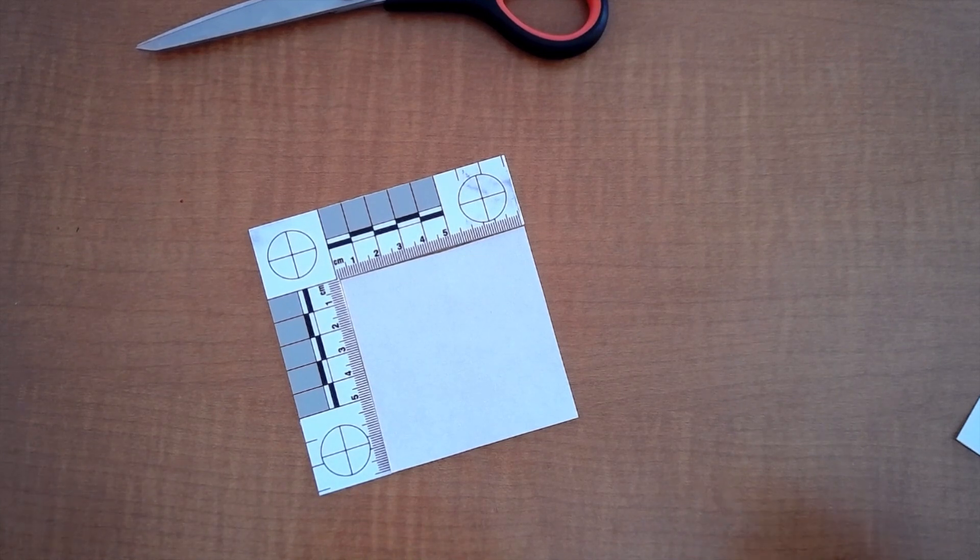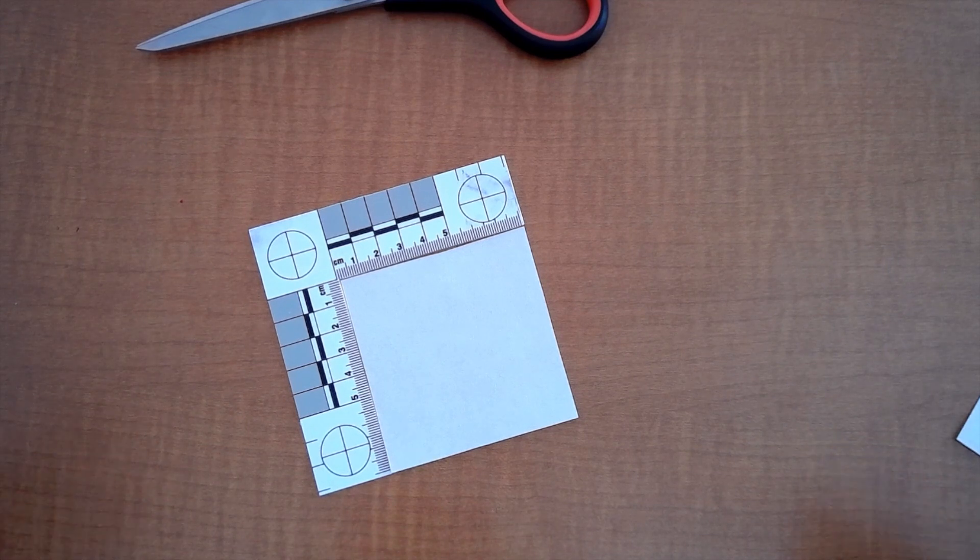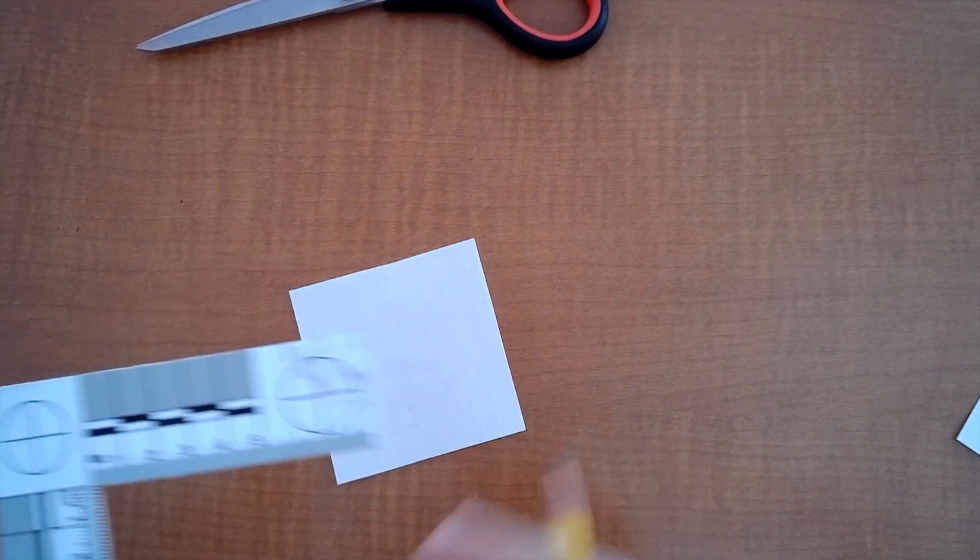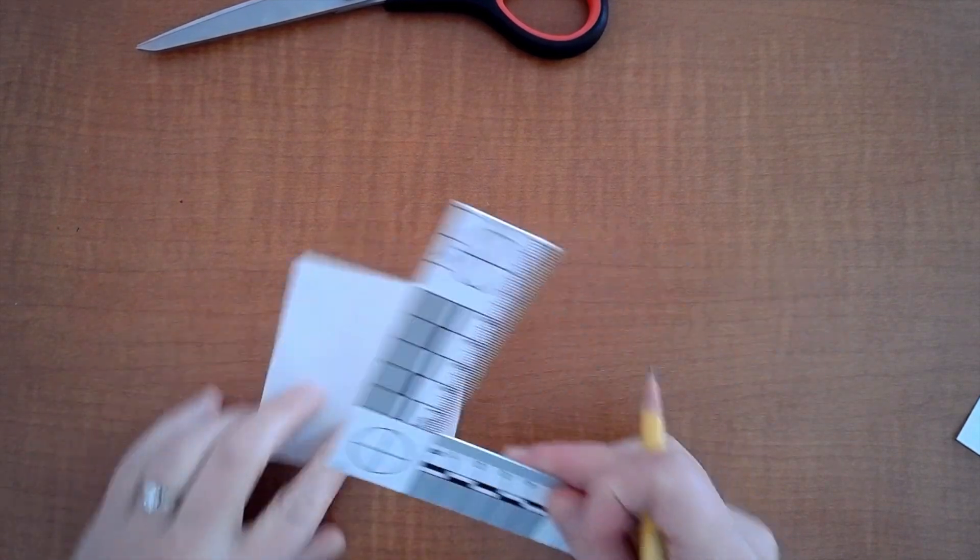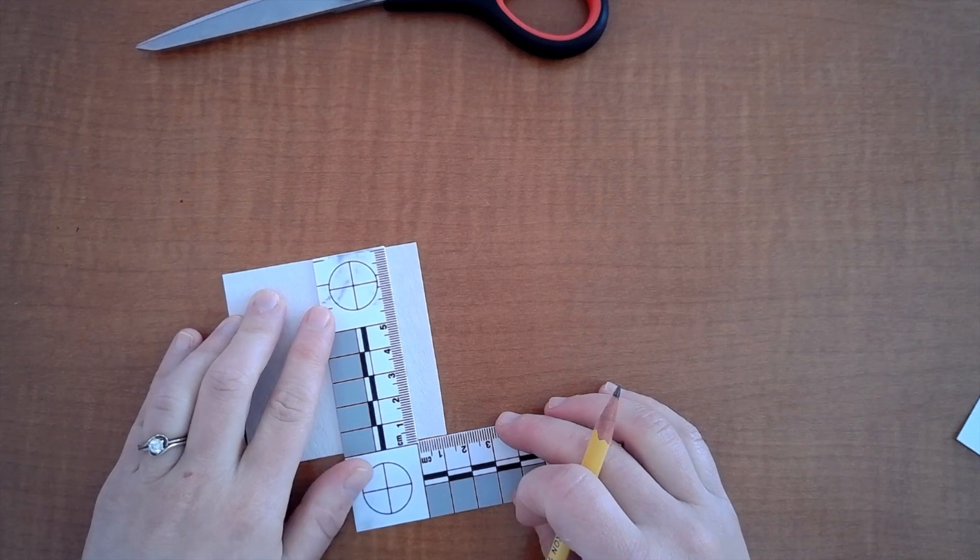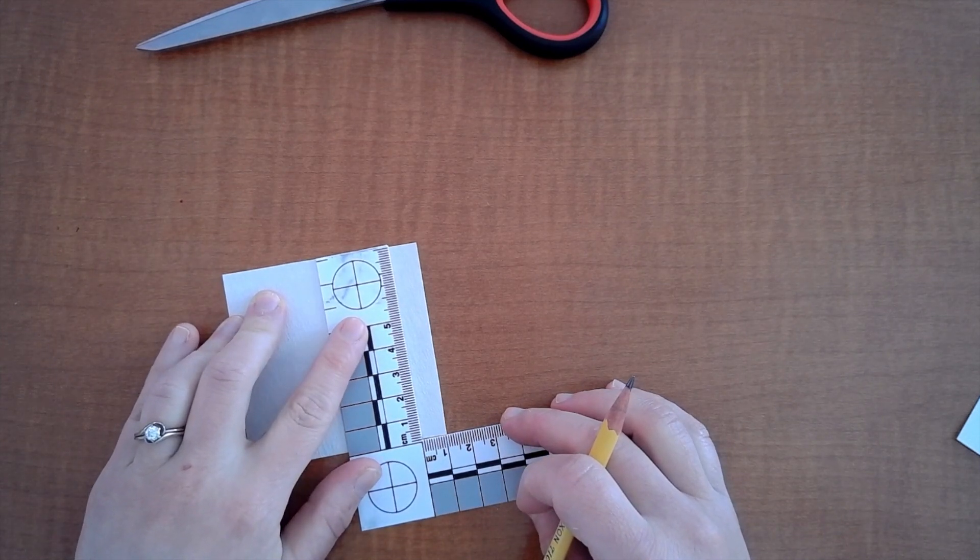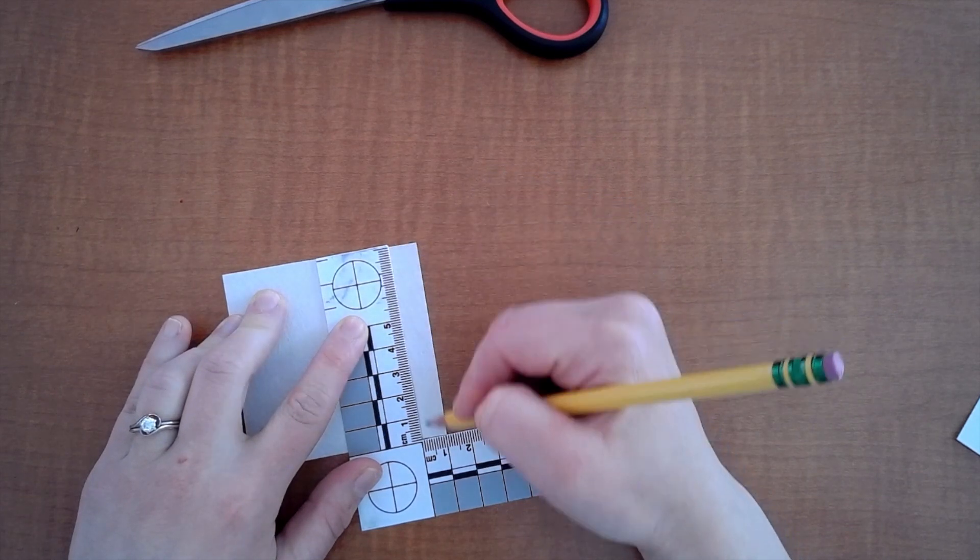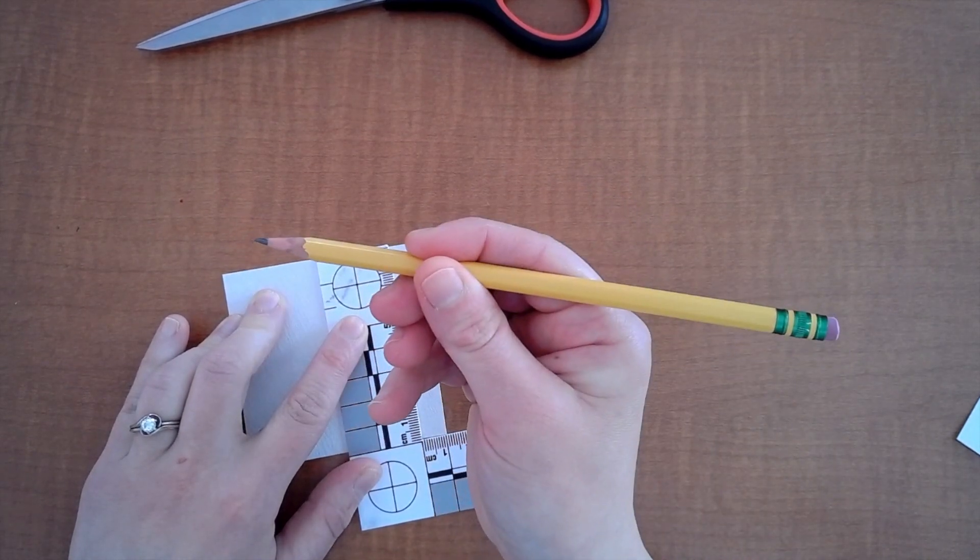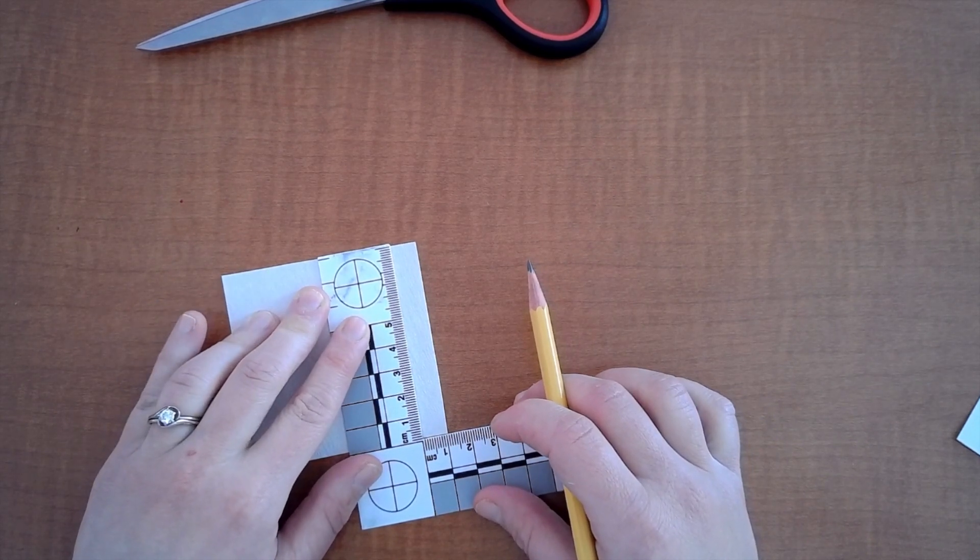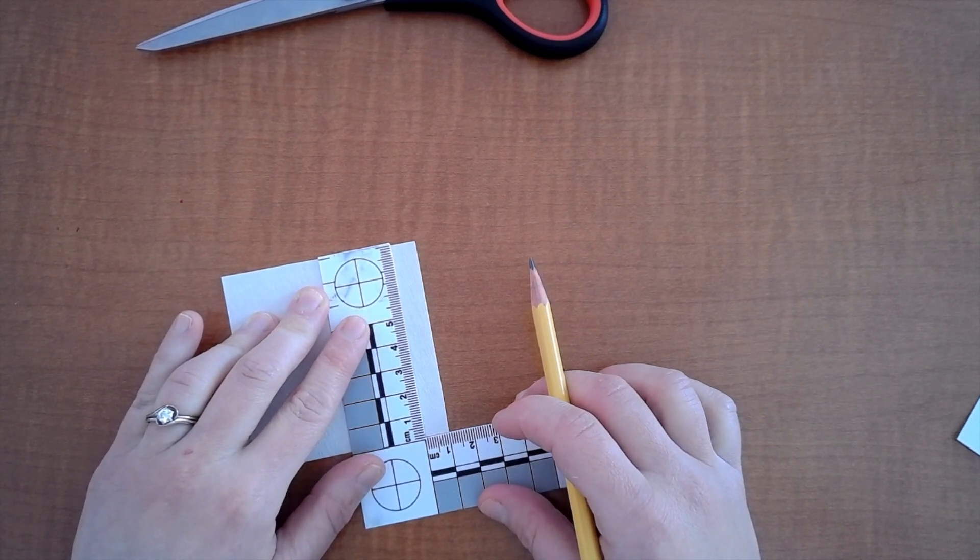Okay now what? Well I'm going to need a place to put my inks so I need to set that up. I'm going to take my L-shaped ruler and my little square and I need to mark one centimeter up. So what I have right here is one centimeter and I need to draw a line and you'll see I'm using pencil.